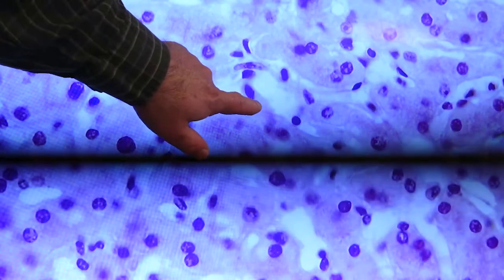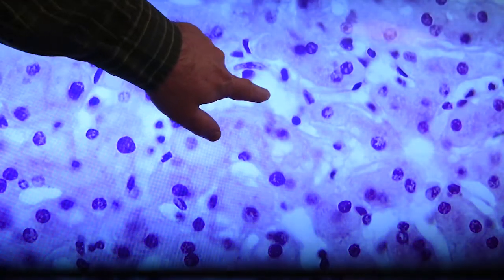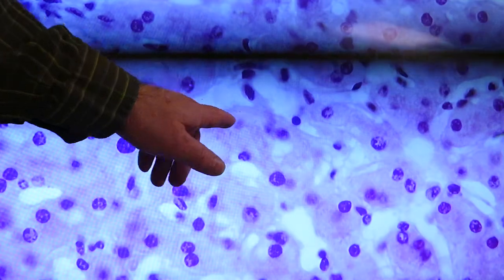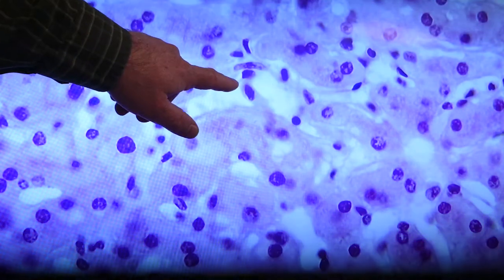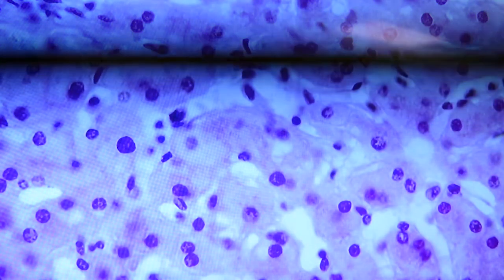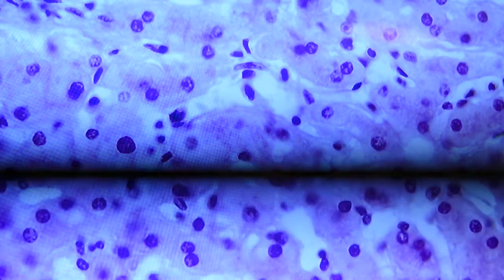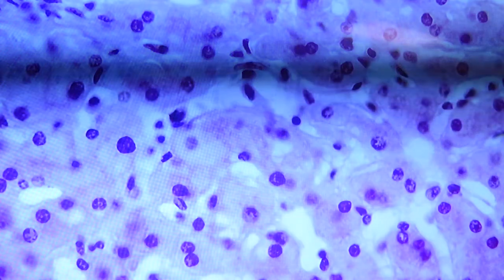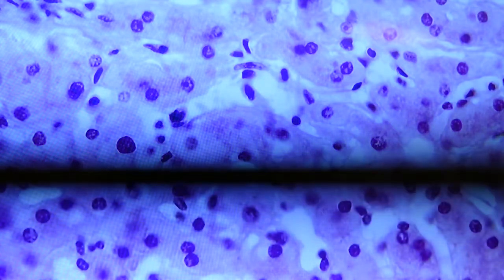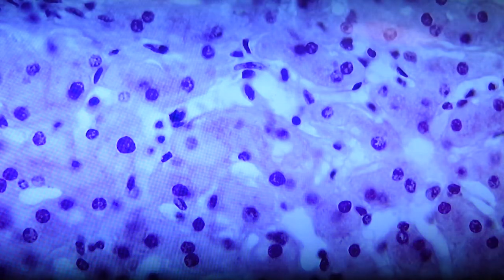This cell right in the middle, though, right there, has a nice shadow of cytoplasm around the nucleus, and it's in a sinusoid space, so that's a Kupffer cell. There, that's what you look for. You look for a cell in a sinusoid with a shadow of cytoplasm around a nucleus. It's kind of an irregular shaped cell. So once again, we see hepatocytes, sinusoids, endothelial cells, Kupffer cells, and space of Disse, all in that view.